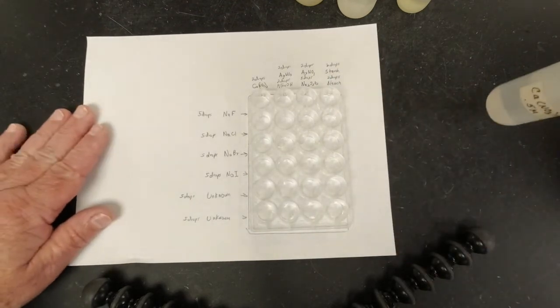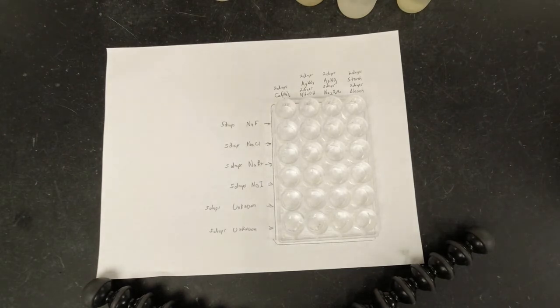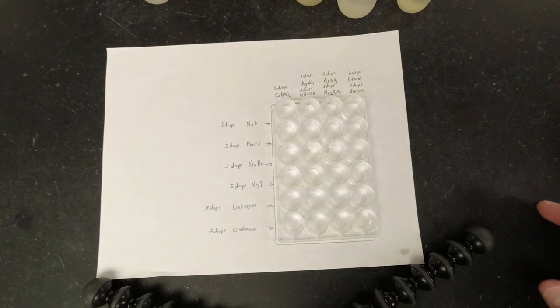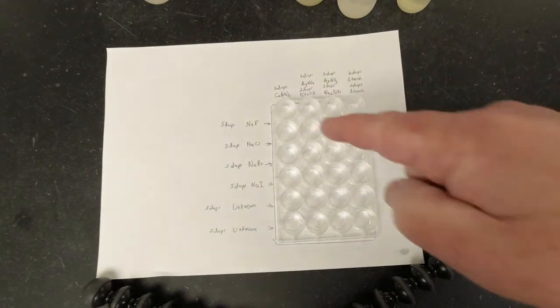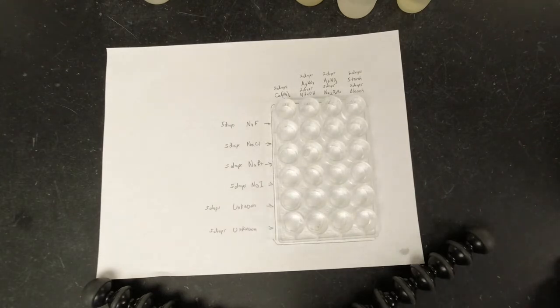So it seems like calcium nitrate might be a good thing to use to identify fluorine or fluorides in a substance, all right? So if you need to pause for a minute, write that down. In the first one, you would write that there's a white precipitate, and then the next 4 down here, you would write NR for no reaction. Pause it if you need to.